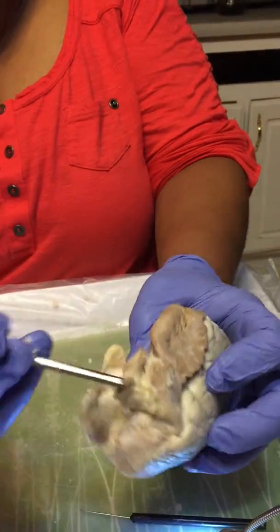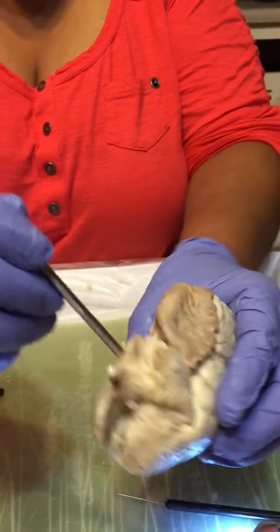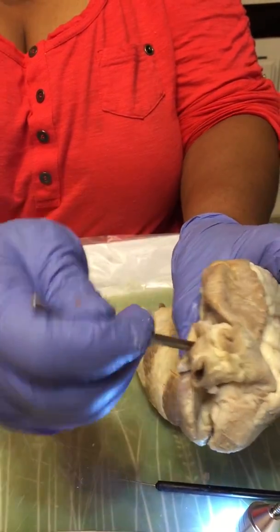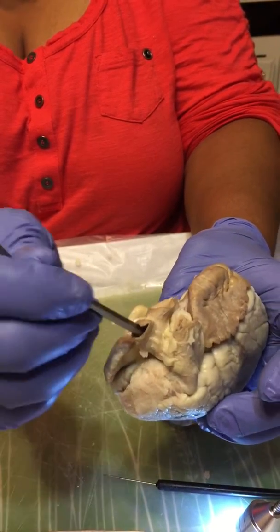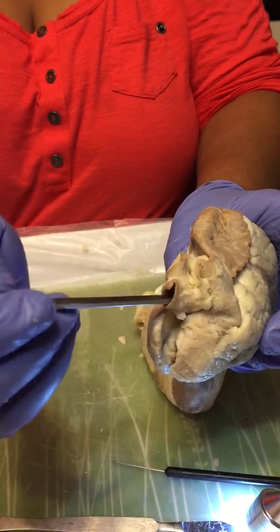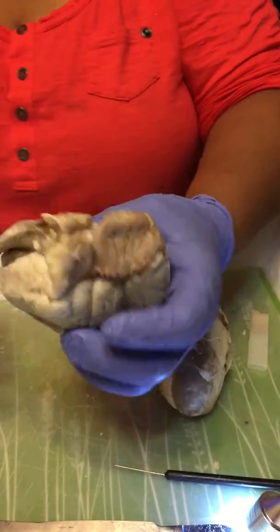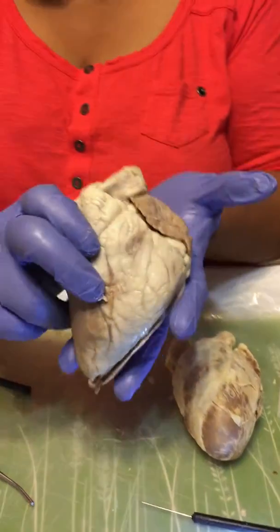And then, as I said, this is the main vessel that will go out to the circulation with oxygenated blood. And this right here is a brachiocephalic, which you can see is a branch right here that will also go out into the circulation toward the upper body. And this will carry oxygenated blood.